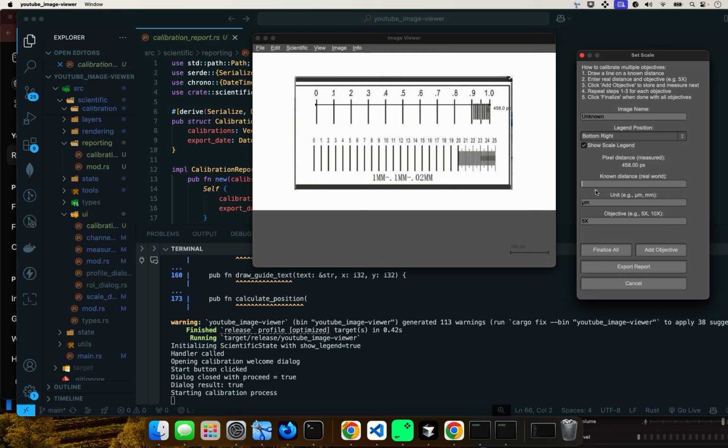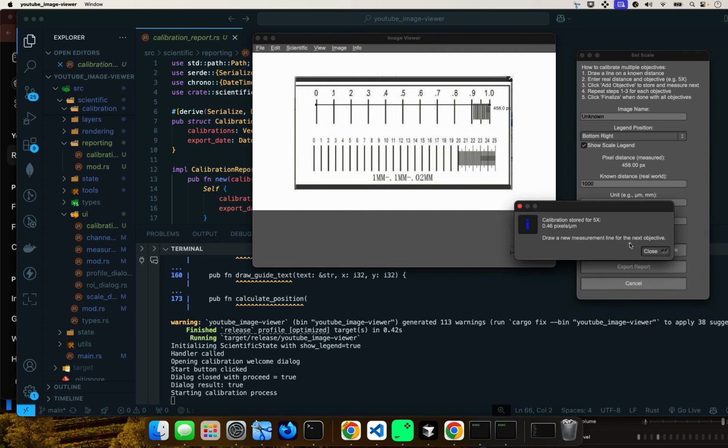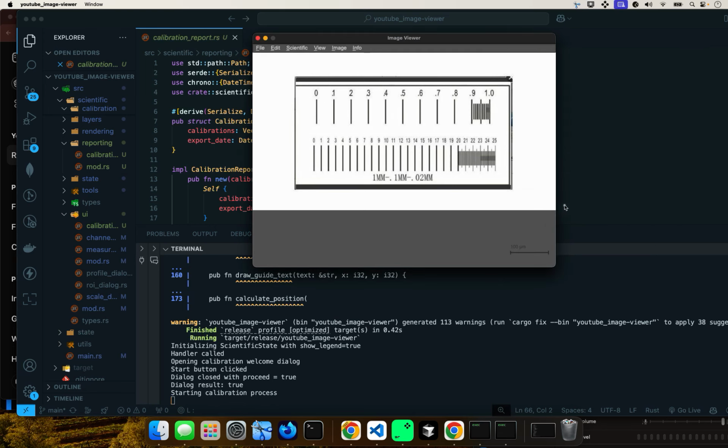We put the distance. This is a stage micrometer. Let's call it just 1000 microns for simplicity. This is 1000 microns, 5x objective. Okay, so I'm going to change objective. It gives you these nice hover instructions. So you add the objective. It stores the data for the 5x objective, and then you do it again for the next objective, right?